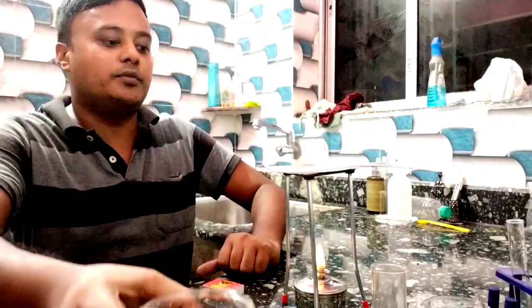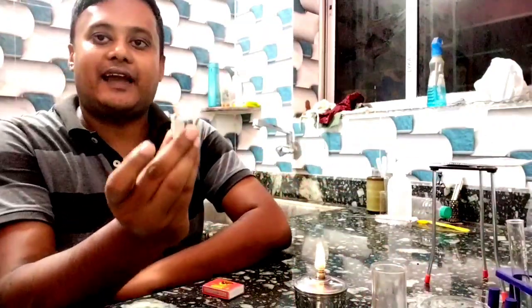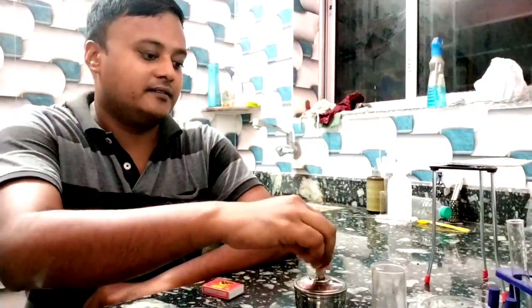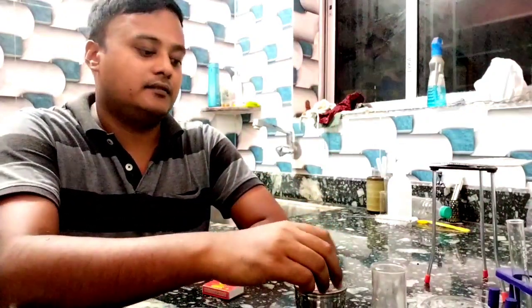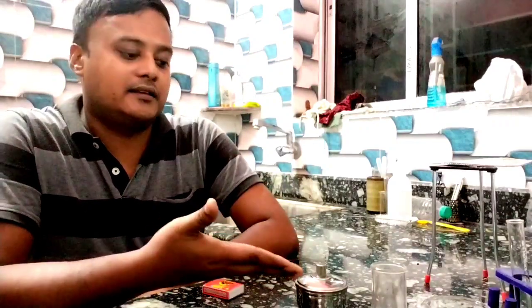When the experiment is over, just place the cap over the flame — in the absence of air it will stop. We use spirit as fuel. You can also use sanitizer in it; presently I am using liquid sanitizer, not the gel type. It can also be used as fuel in the spirit lamp.